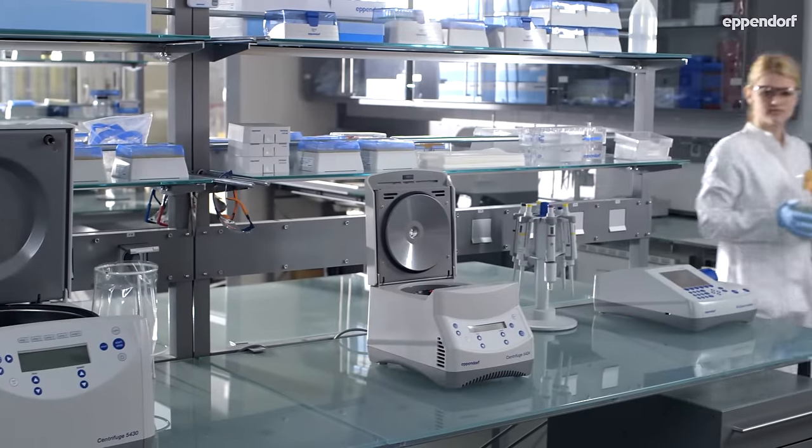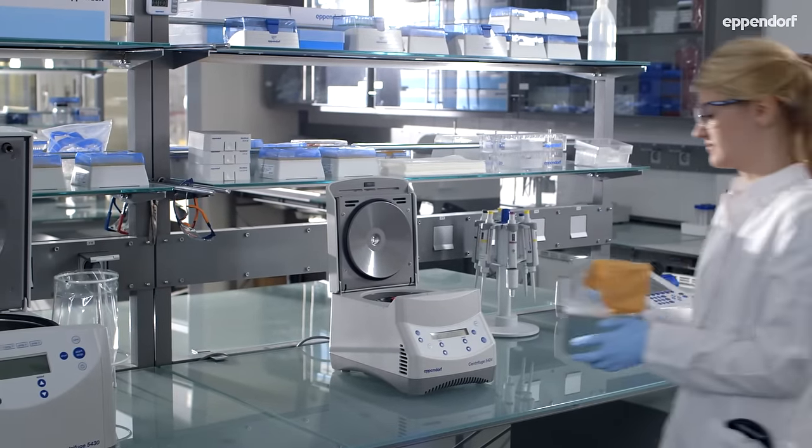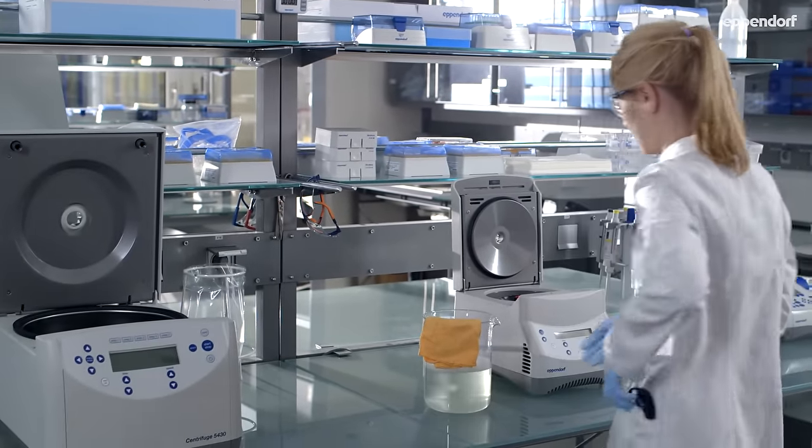For optimal conditions and safety for your centrifuges, we recommend maintenance on a regular basis.